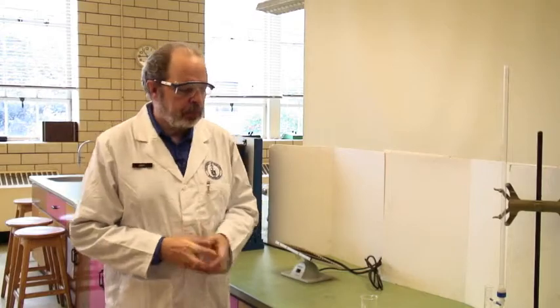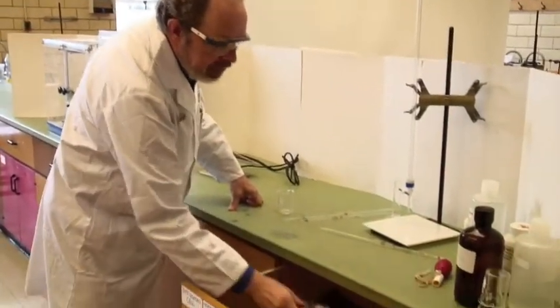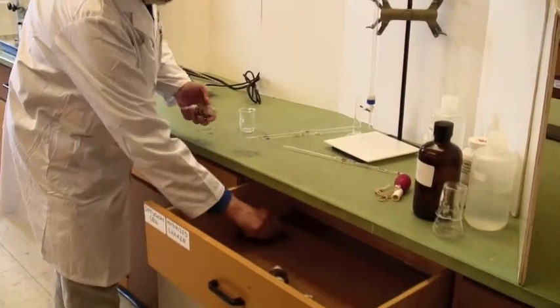This video is to show you how to use the equipment for experiment E2, membrane diffusion. The diffusion cells are kept here and they look like this.